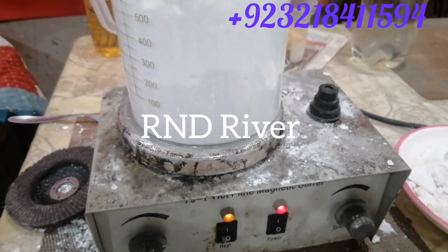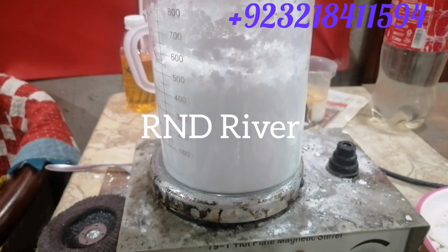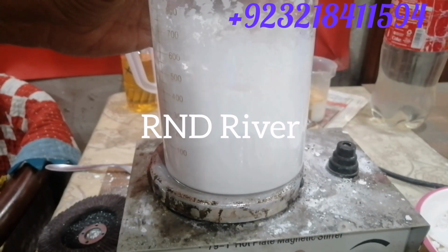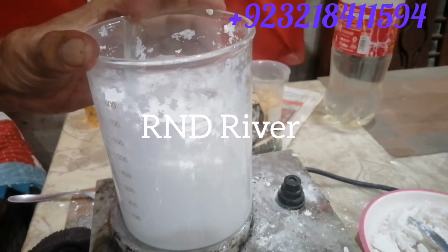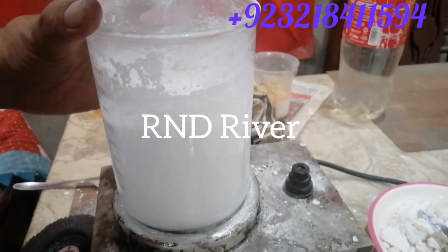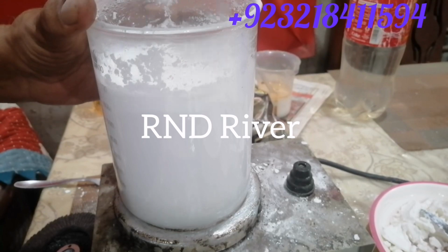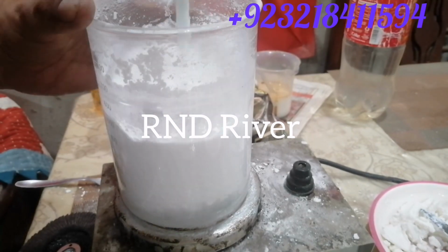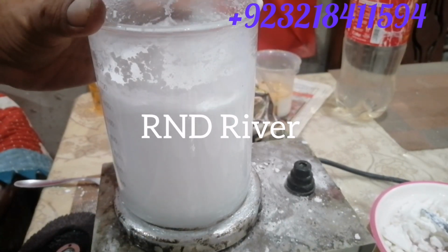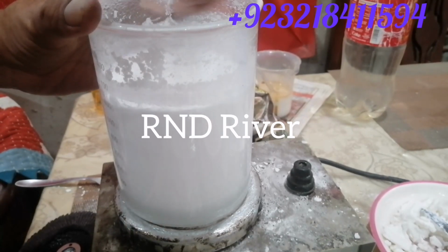Now look, as we raise the temperature, the reaction goes faster and the separation increases. The temperature must be between 95 and 100 degrees centigrade. Must. Stir well in the whole process, A to Z. Stir well. Look, when you stir, the separation of water increases. The water level goes higher when the reaction is going to be complete.